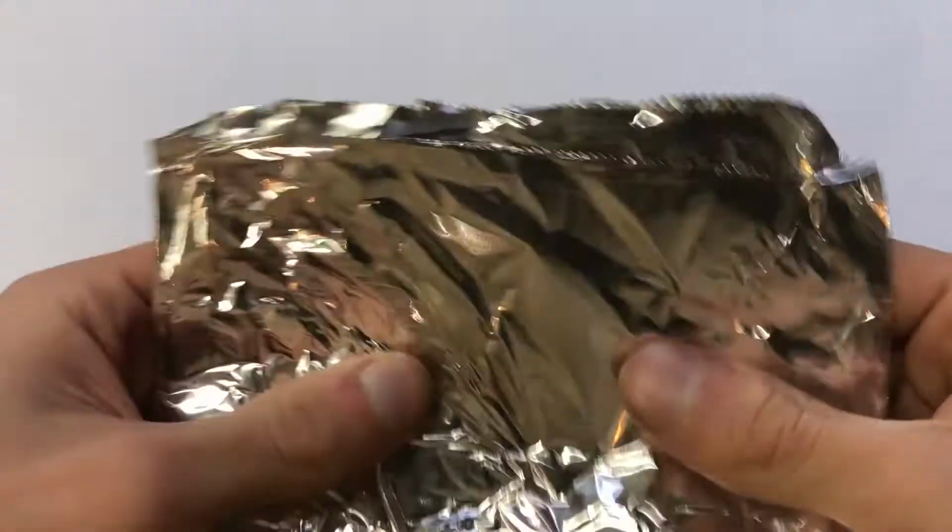Tin metal's name is used in many things, even though they mostly don't contain tin. Tin foil, which is actually aluminum, tin roofs, which are actually steel, and tin cans, which are steel, even though some of them, like peach cans, have an electroplating of tin inside to protect the can from its acidity. Tin also has some other unique properties. But let's first get some tin out of the ore and then explore those properties.